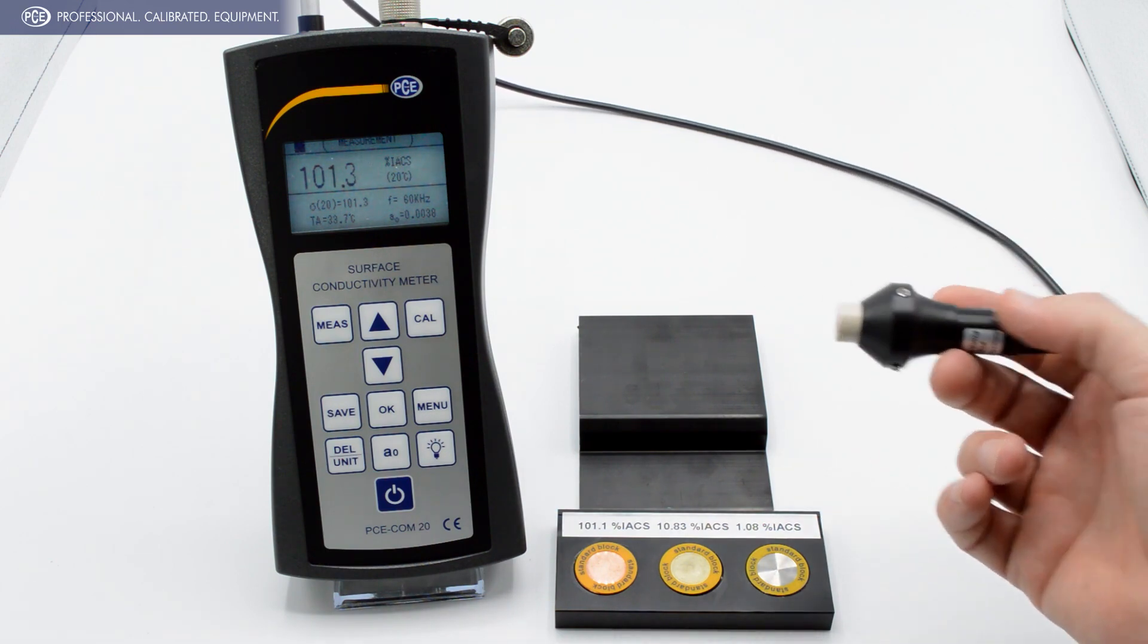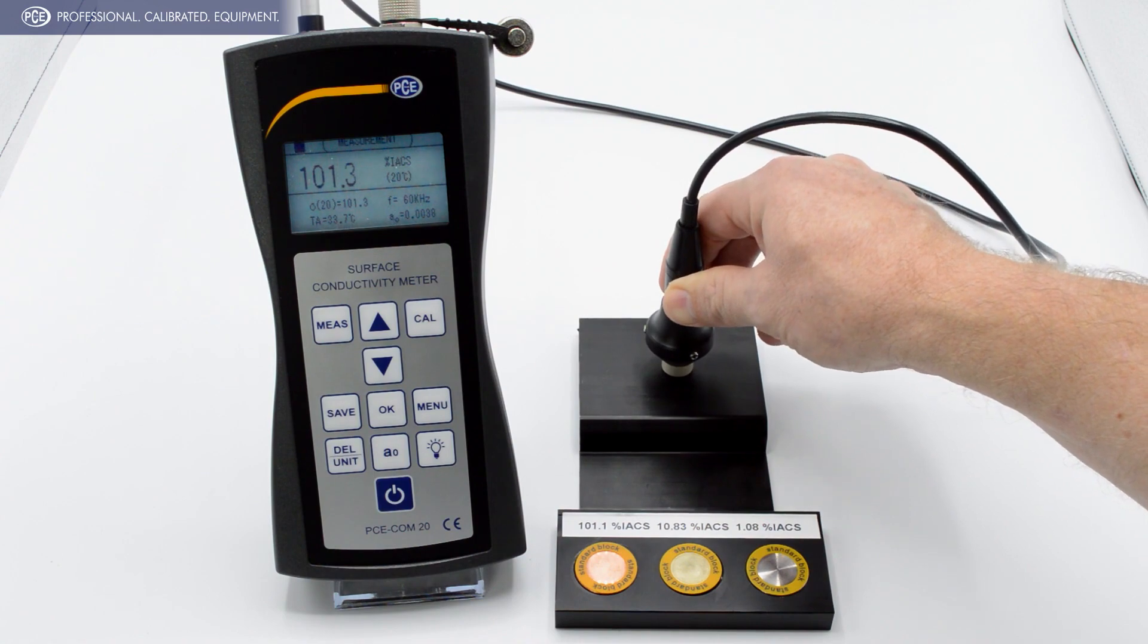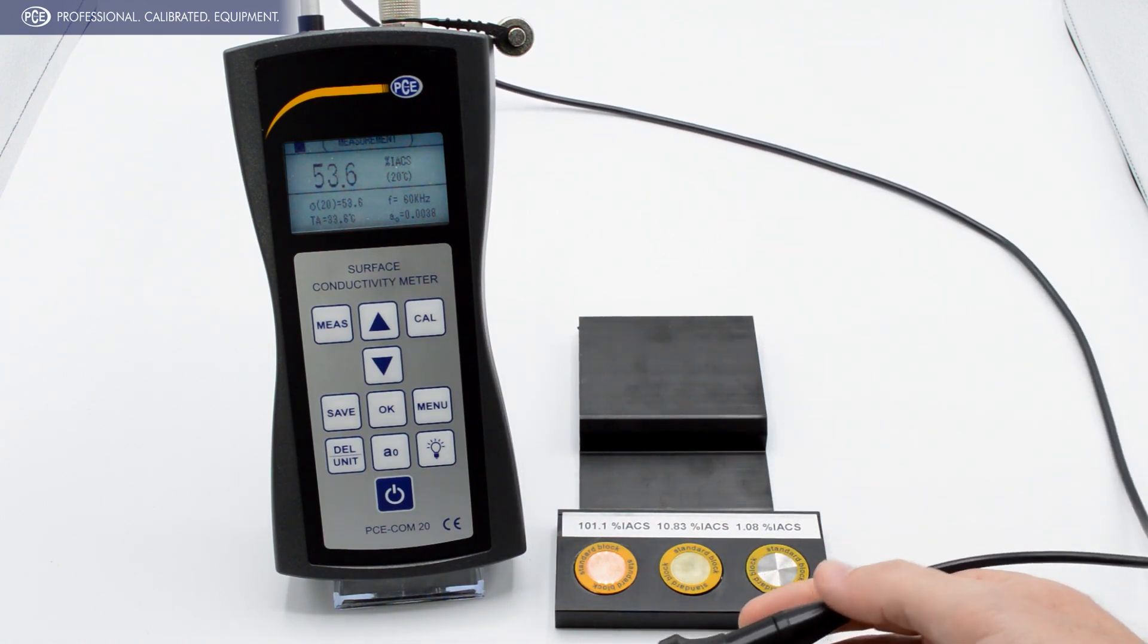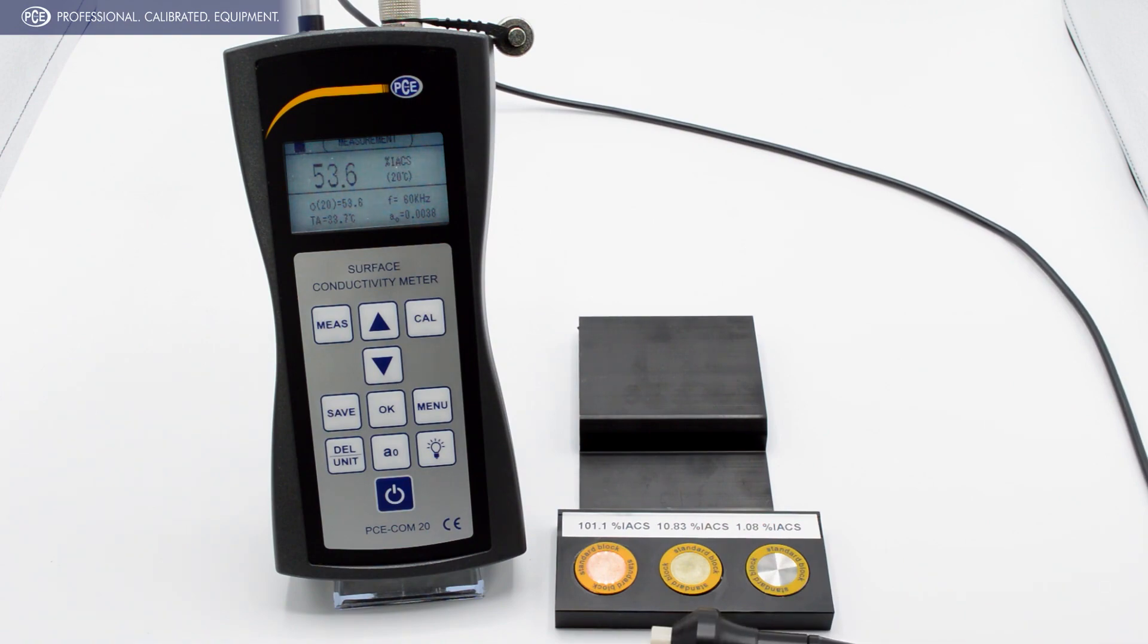So after you go ahead and do the calibration you can go ahead and do your test. And that's really all there is to it. If you have any questions give us a call or check us out on the website.